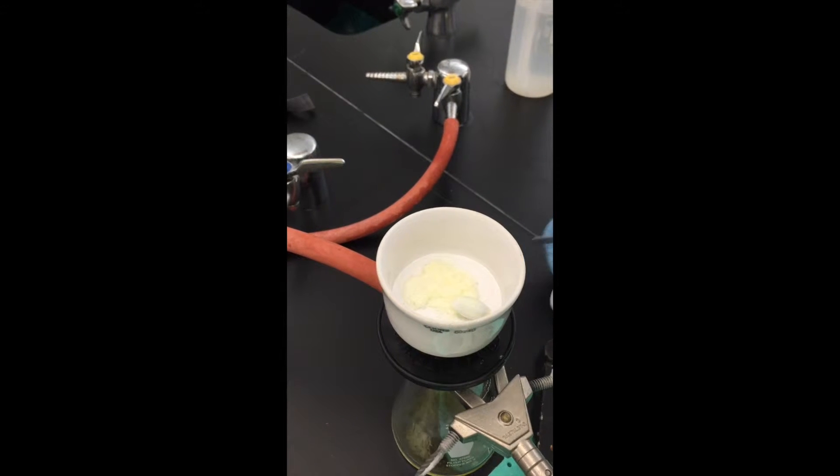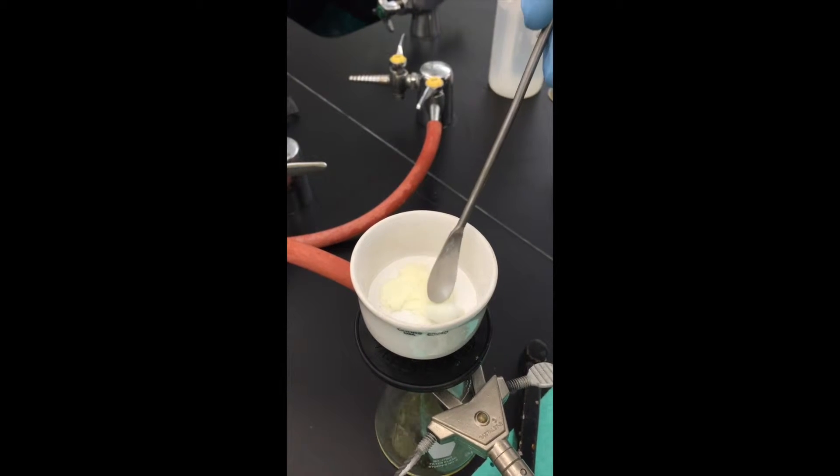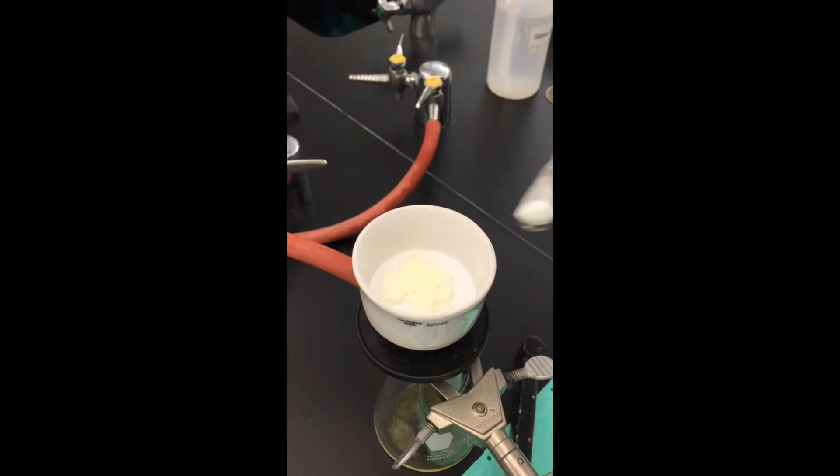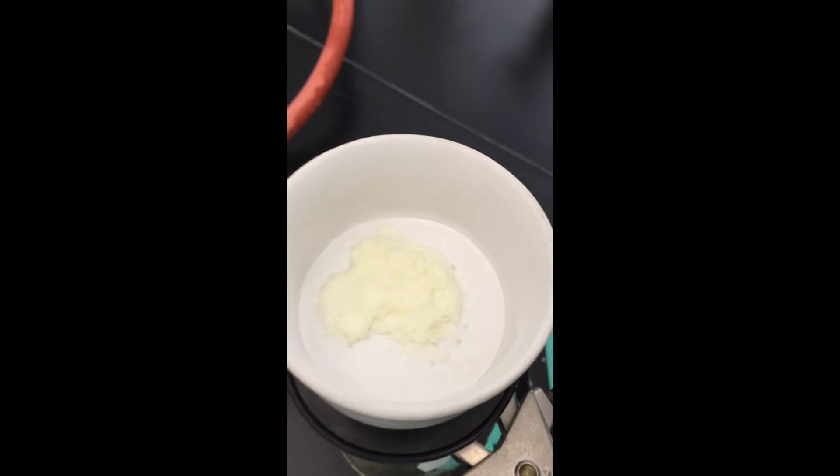We are going to take out the stirrer. And already you can see we have a pretty solid precipitating out.